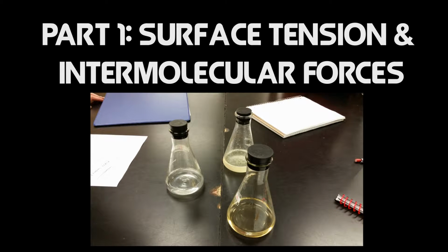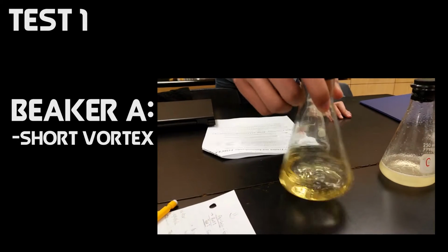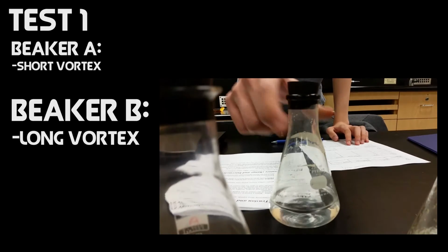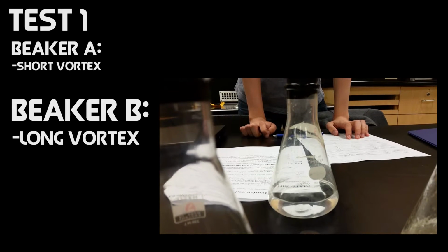Enjoy the video. In the first experiment, the surface tension of water, isopropyl alcohol, and glycerol was tested. The first test was conducted by observing the vortex of each compound by swirling it in a flask. For beaker A, the solution formed a short vortex which evened out very quickly. For beaker B, this solution created the longest vortex. It took the longest to level out.